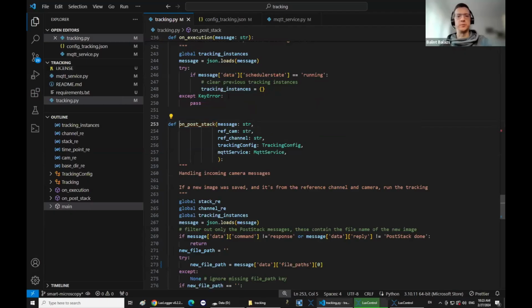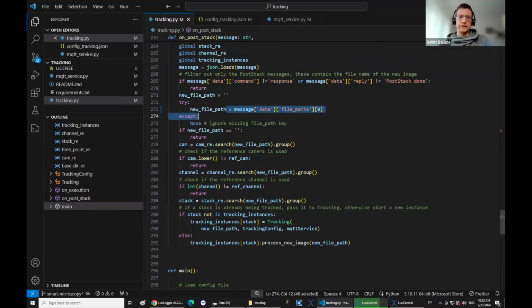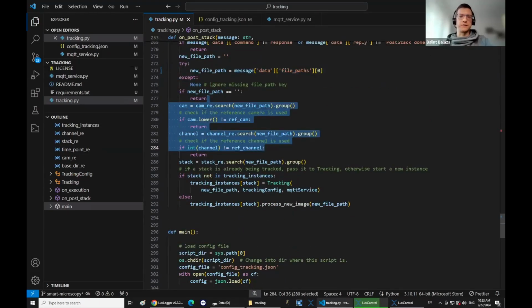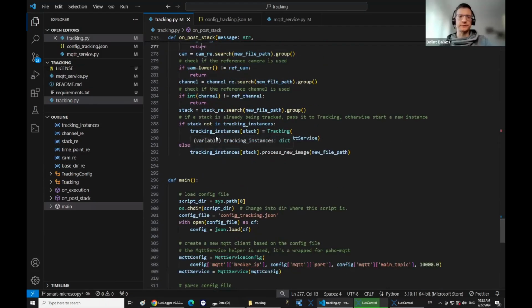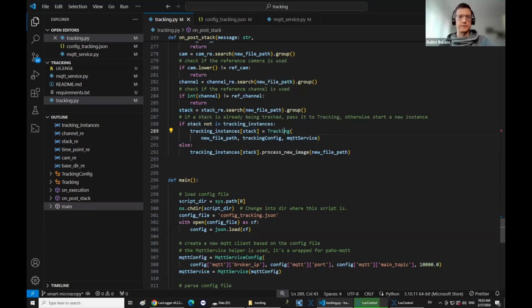And then here, there's a little bit more, but basically it's mostly just parsing the JSON messages and the file path, and checking if these are coming from the reference camera and the reference channel, and then you check this stack ID. Because you can have multiple positions, multiple samples for each stack ID, we start a new tracking instance. So here I just instantiate a new tracking instance for the stack, and if it's already running this tracking, then it will just process the new incoming image.